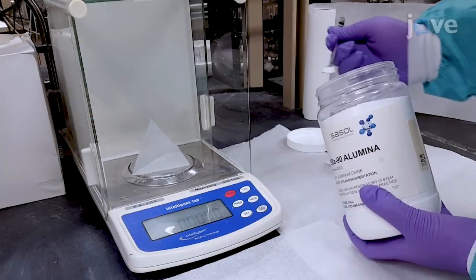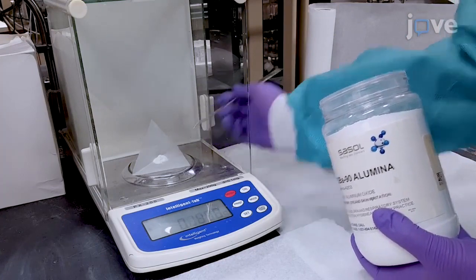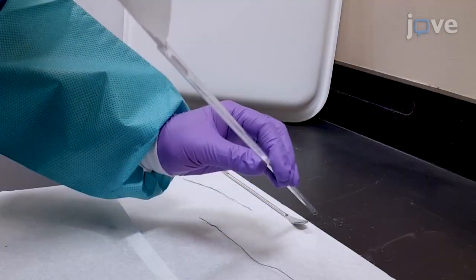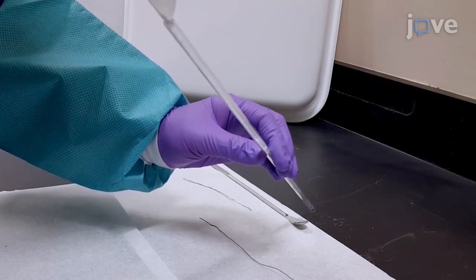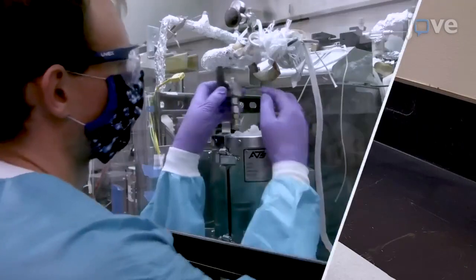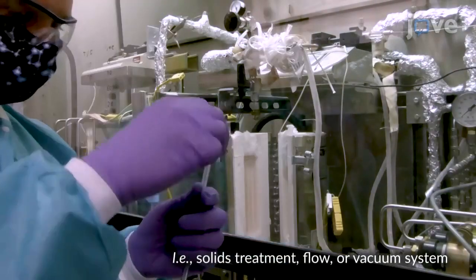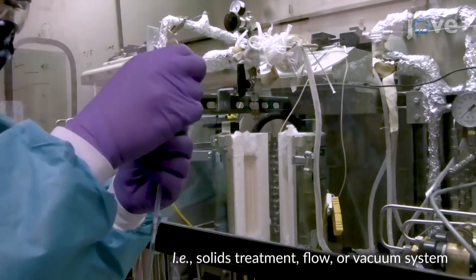For pretreatment of the sample solid, weigh approximately twice the mass of the solid sample that is desired for the NMR experiment, and place the solid sample into a quartz sample tube plugged with quartz wool. Connect the isolation valves to the tube for the pretreatment of interest, and fix the end of the tube onto the gas isolation valve in the open position.